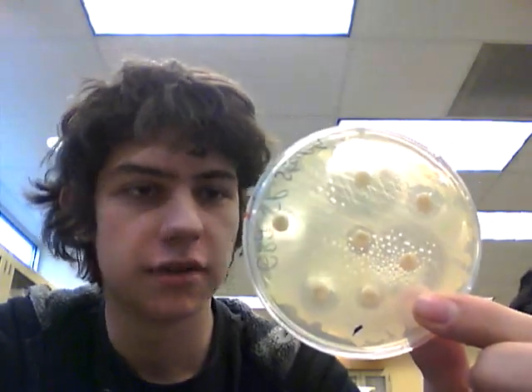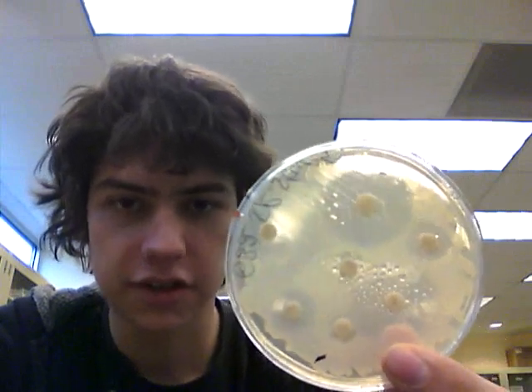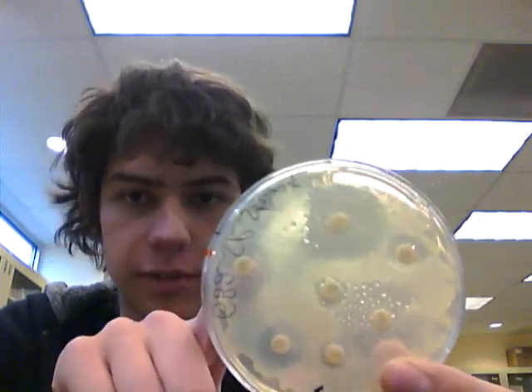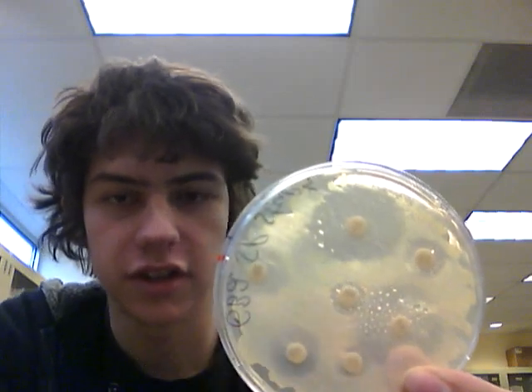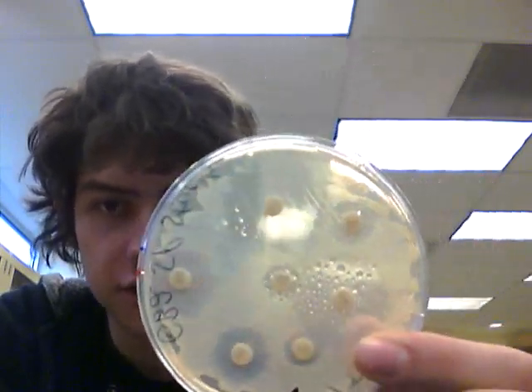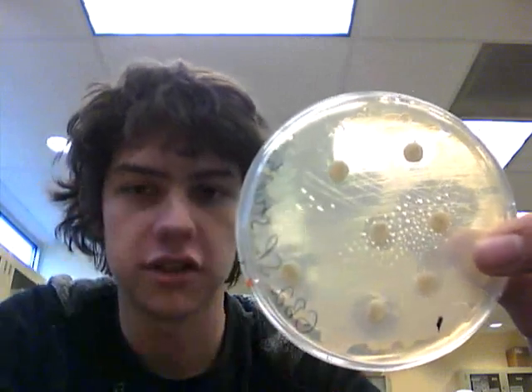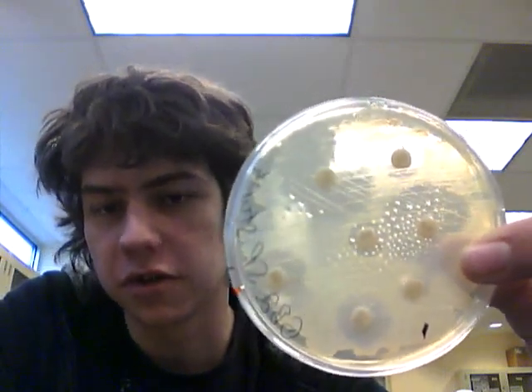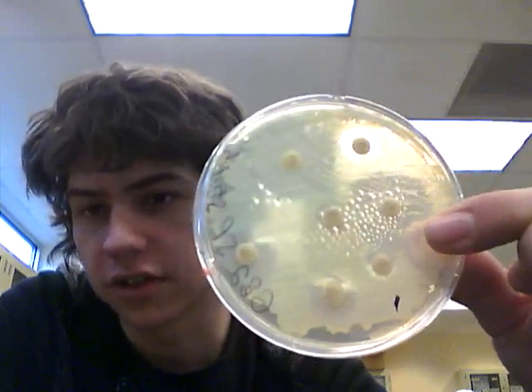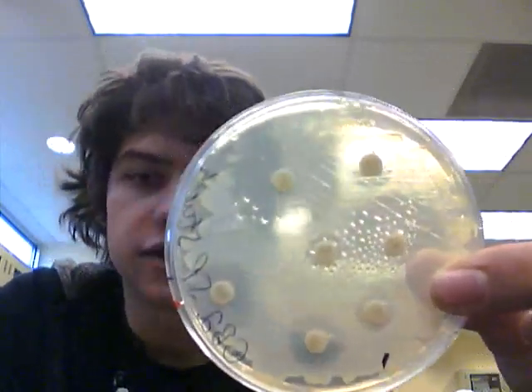We got our bacteria out of the incubator, and as you can see, these antibiotic tablets managed to inhibit bacteria in their zone. We measured all the bacteria with all the inhibition zones and compared them to standard comparison charts of whether a bacteria is resistant, intermediately resistant, or actually susceptible to the antibiotic.